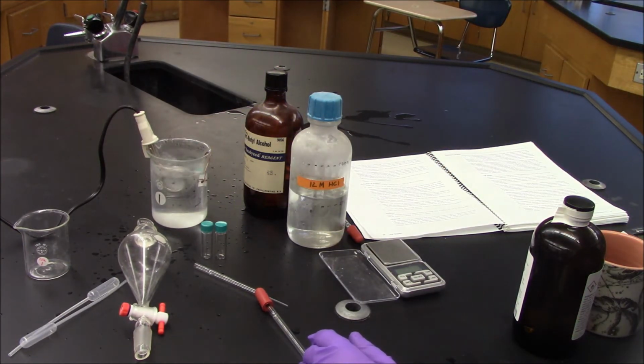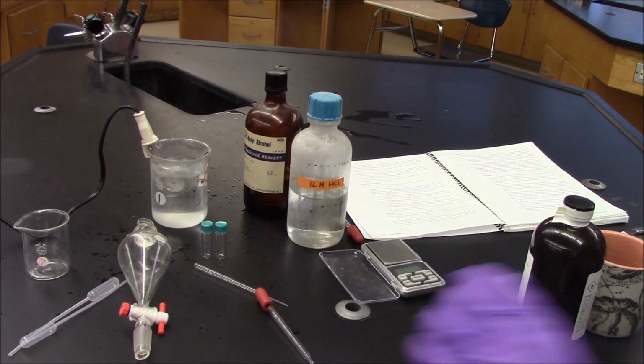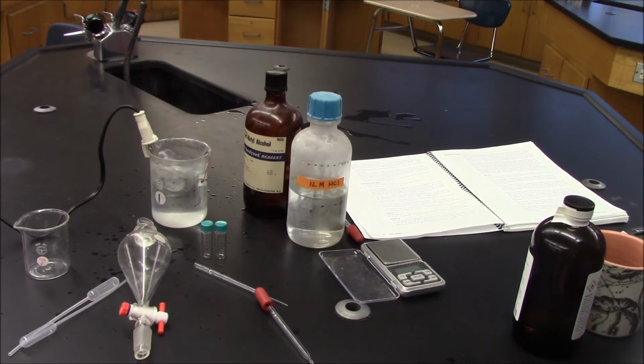Wish me luck. There's already some vapor coming out, but I'm doing the best I can here, right? Well, I'm going to let this go for 20 minutes, see what happens. I'll see you in 20.